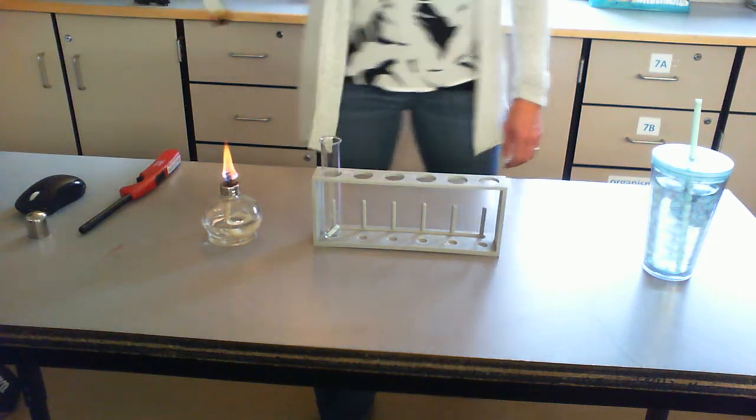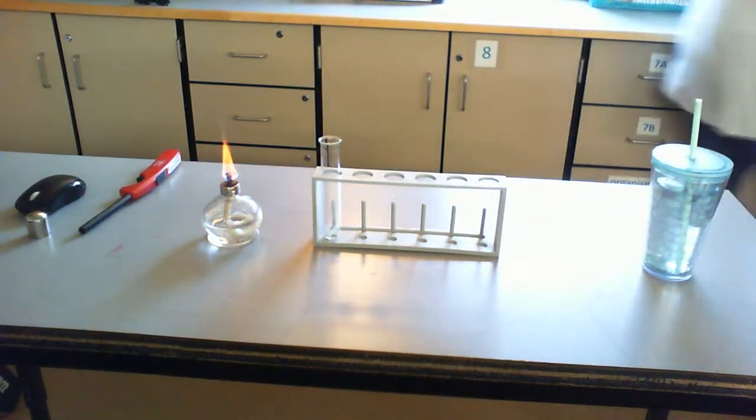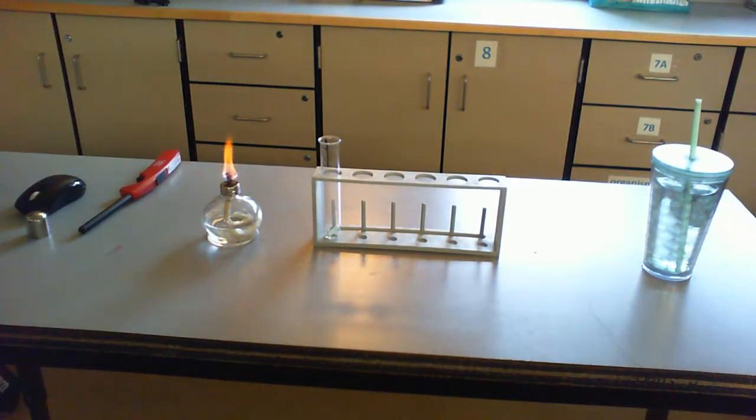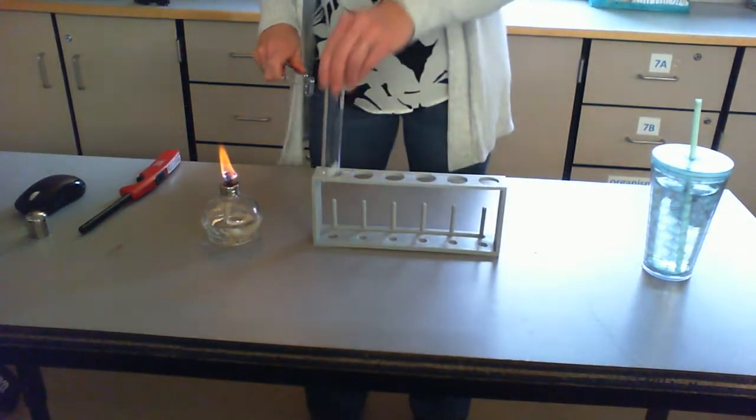All right. So that's my sugar. I'm going to really quickly rinse this out with some cold water. Now we're going to do the candle.